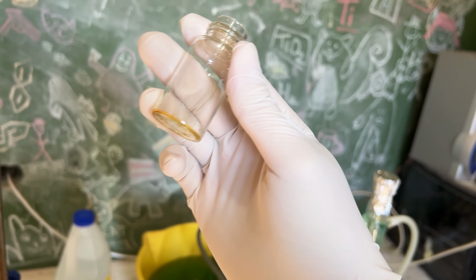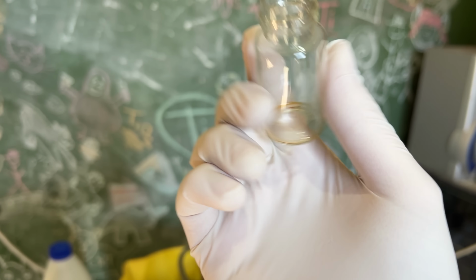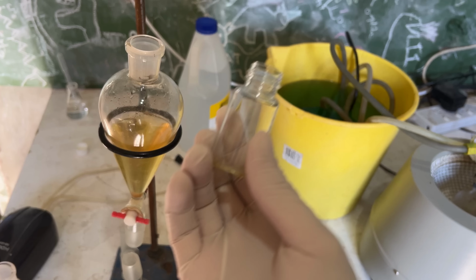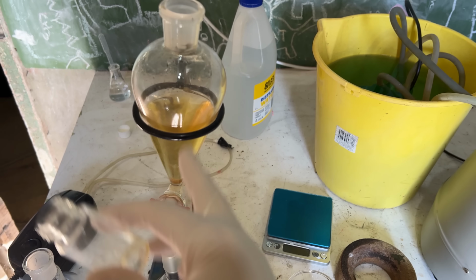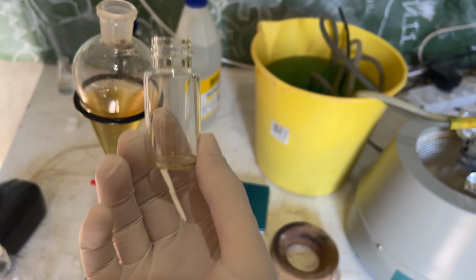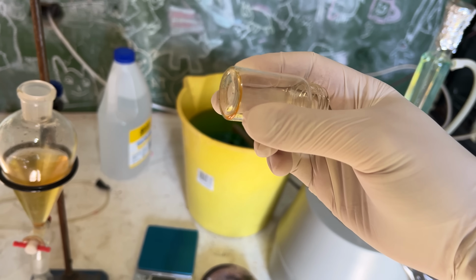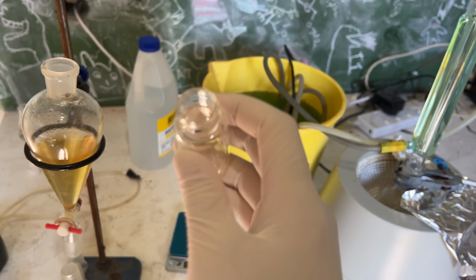And after all that work, we're left with a tiny amount of solid. This is probably cubane, but there's maybe a couple milligrams here, which is just not very much. So I'm going to assume that the cubane doesn't really want to come out of the solution very well and go into the dichloromethane. So to make that a little bit better, I'm just going to increase the polarity of this solution by dissolving a whole lot of salt into it. And then hopefully the DCM can dissolve the cubane out of there a bit easier, because this is not much. I mean, it's potentially enough to analyze, but the purpose is to try and actually get enough cubane to go on to the next step with, not just prove we've done it.